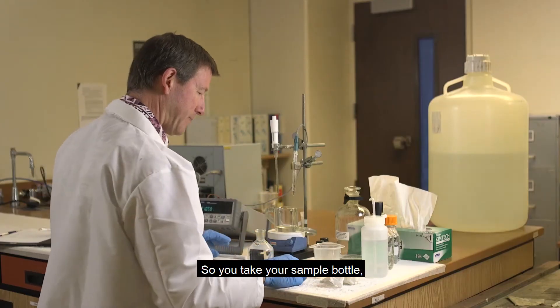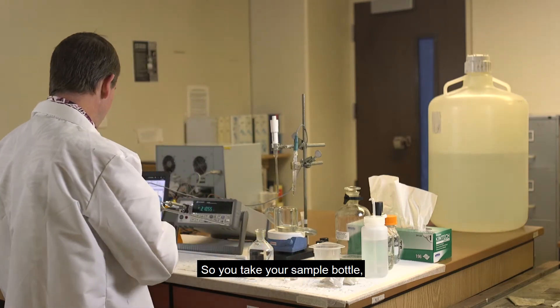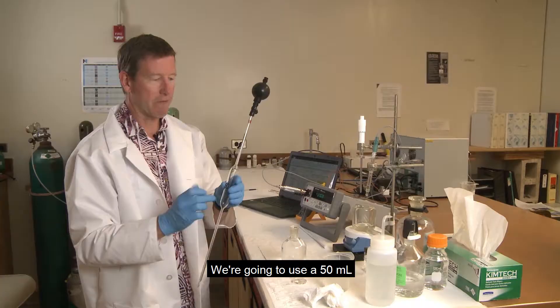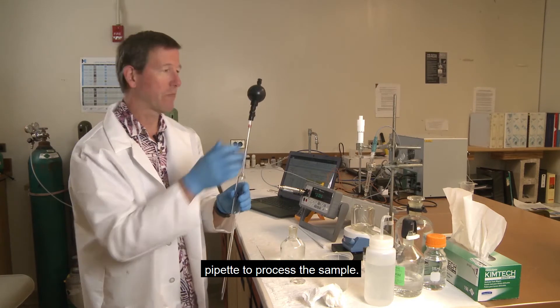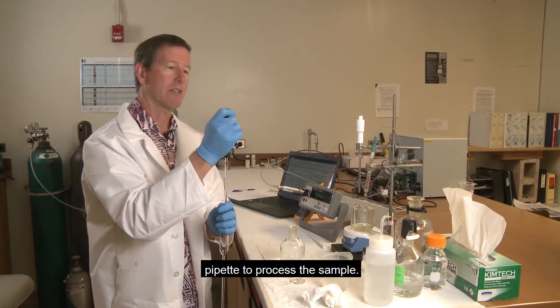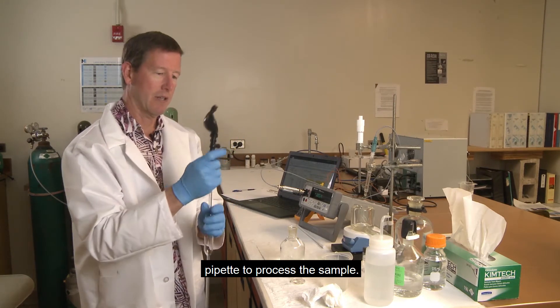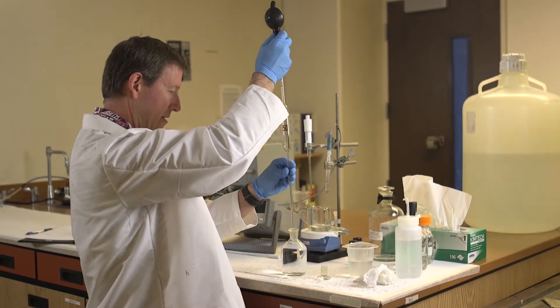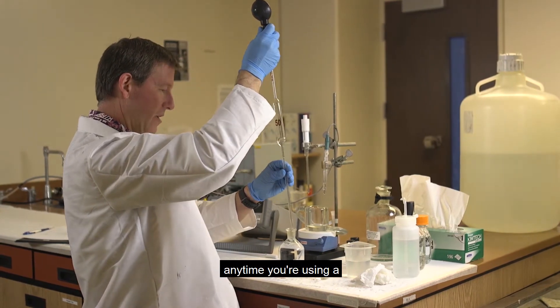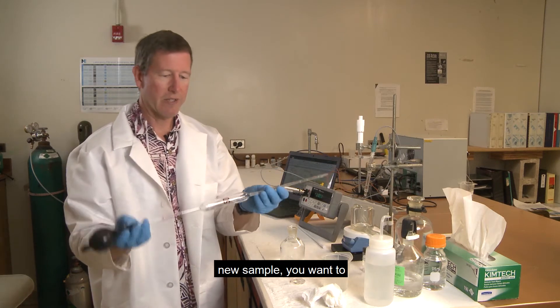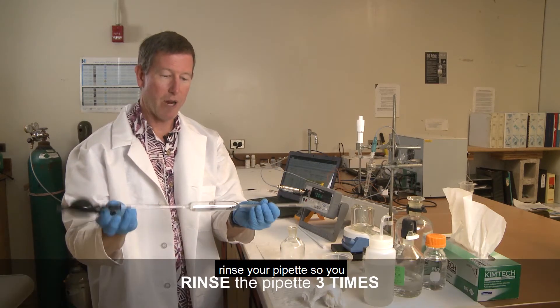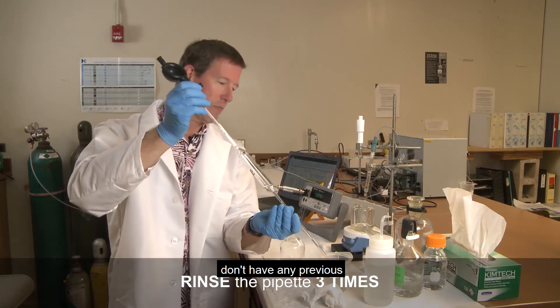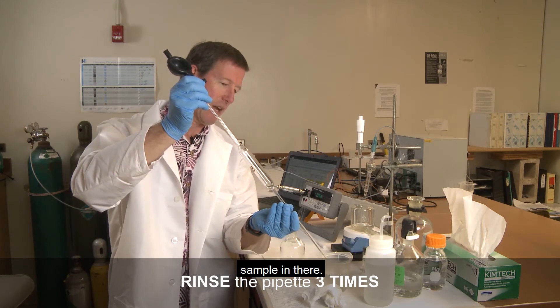So you take your sample bottle, open it up. We're going to use a 50 ml pipette to process the sample. But first, any time you're using a new sample, you want to rinse your pipette so you don't have any previous sample in there.